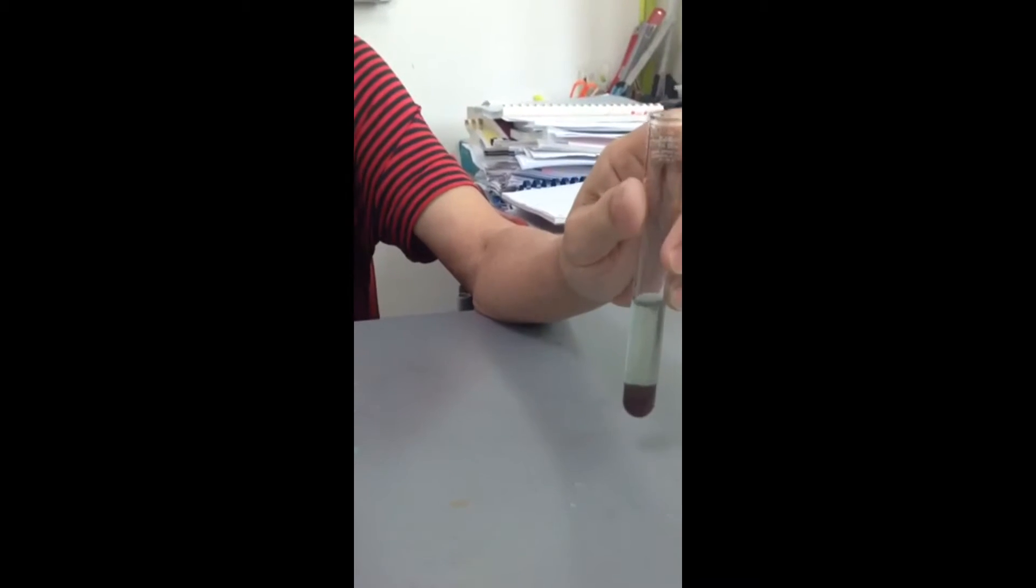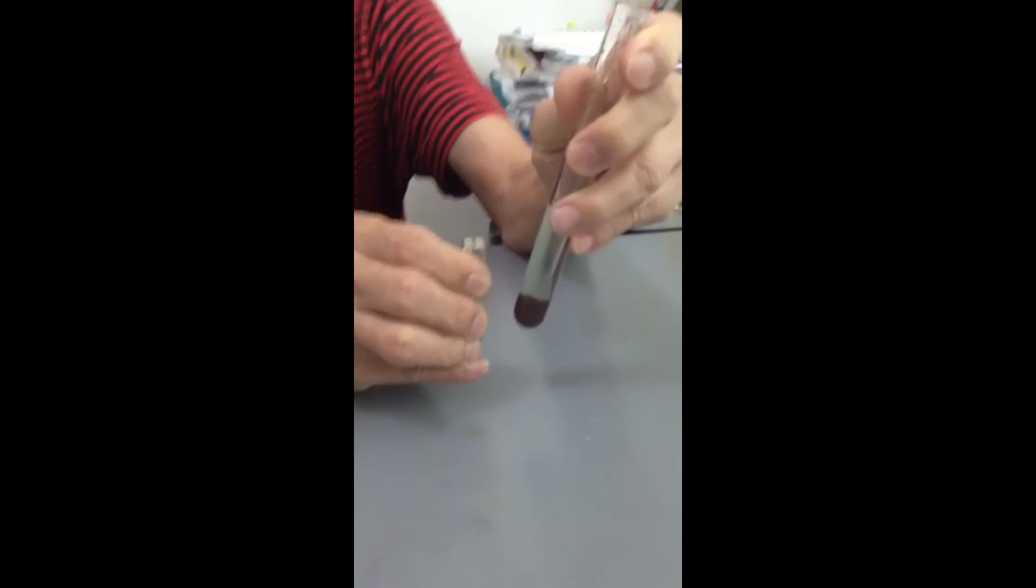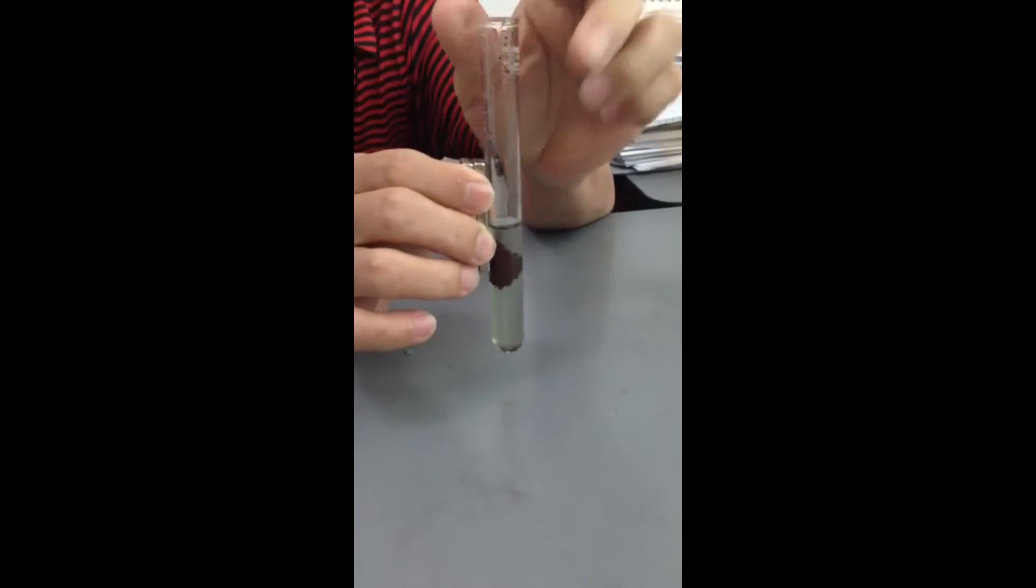But however, copper is not magnetic. Tell me why I still can put this there and then it can still attract it. Tell me why.